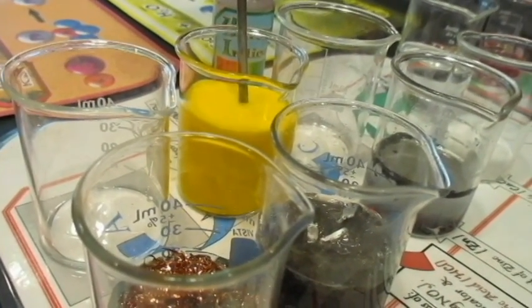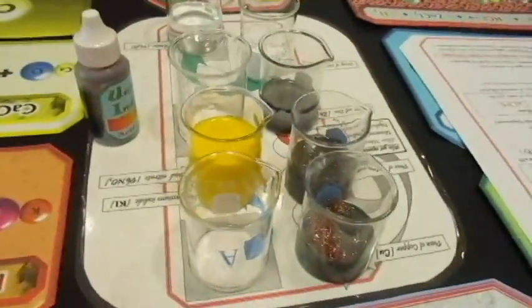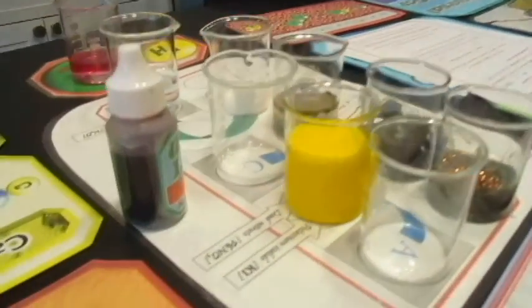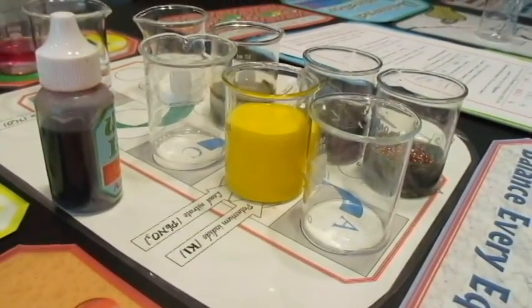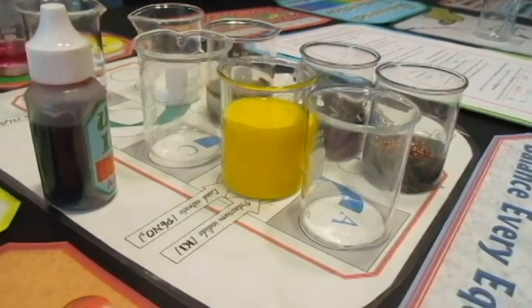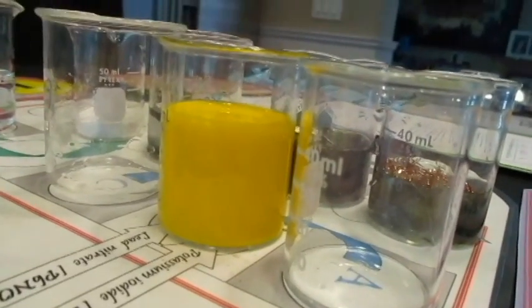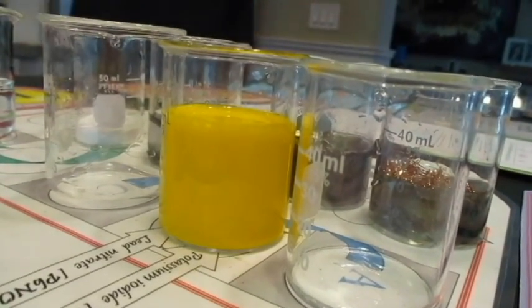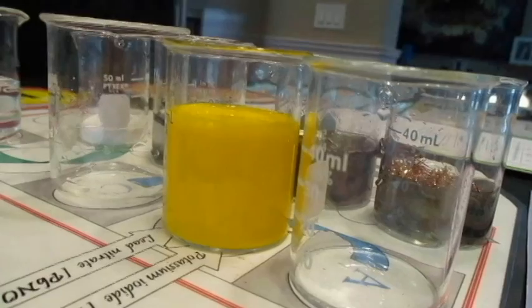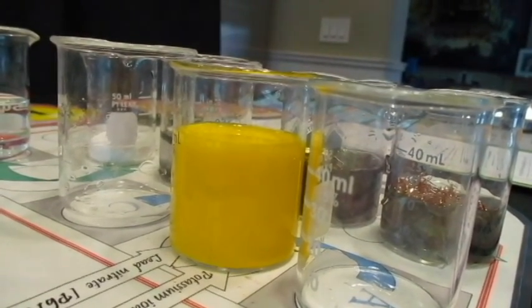Okay, and then we'll measure the temperature again in a few minutes. It's okay. The yellow. Is that pretty? Yeah. So the lead iodide has a pretty color. Now, does it look like it's a liquid right now? Would you say that's a liquid? Yeah. Okay, so let's come back and look at it toward the end of the lab when we're all done.